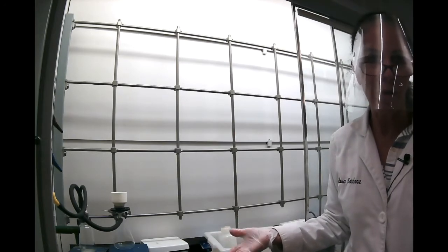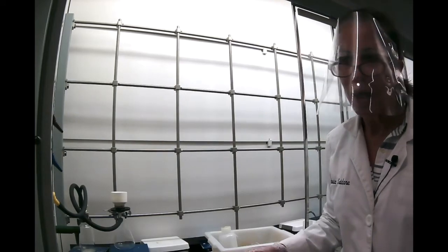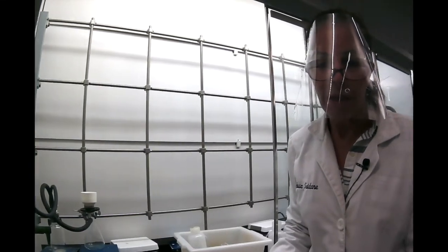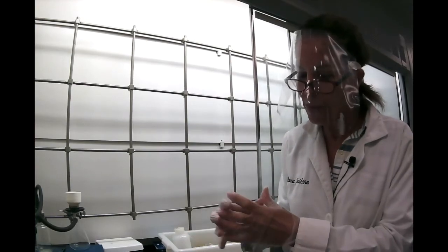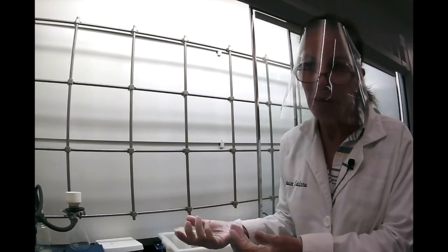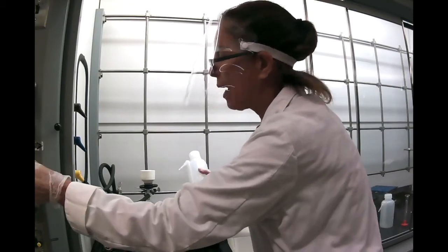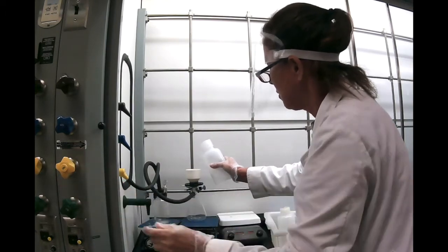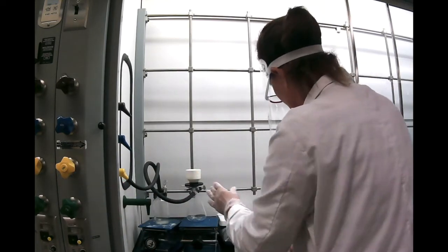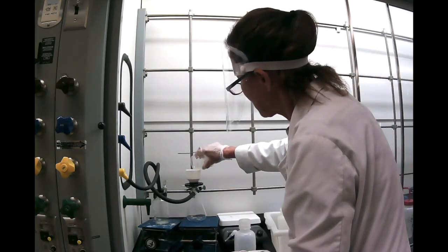But for the sake of the experiment, we need to do it quickly, so we just stick it in an ice bath and wait until you know that it crystallized, when all the crystals are together and it almost looks like there is no liquid in there. Ready for the filtration. You open the vacuum, run some water on your funnel, and you can see that it's secured now. And then you're going to filter your substance.